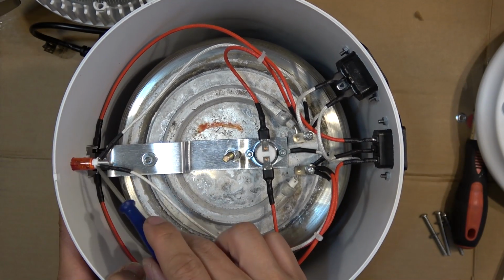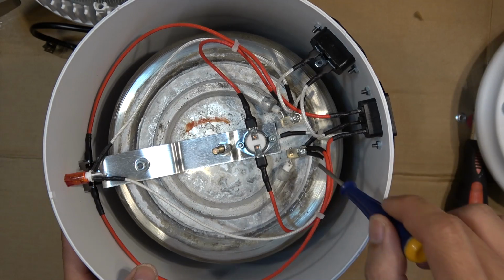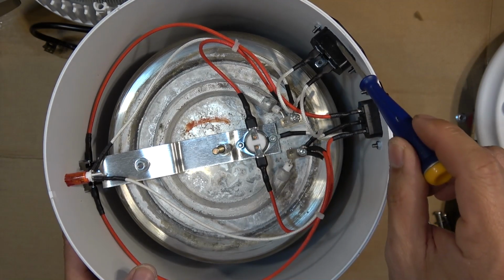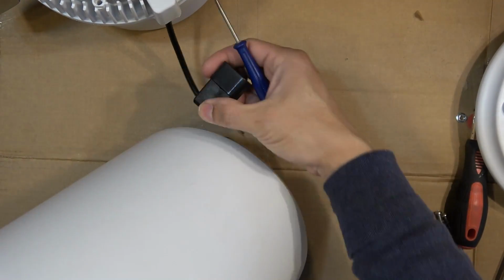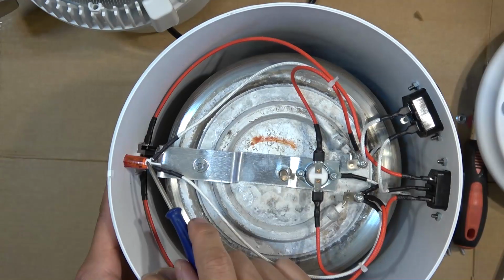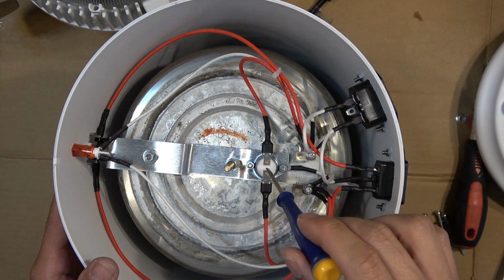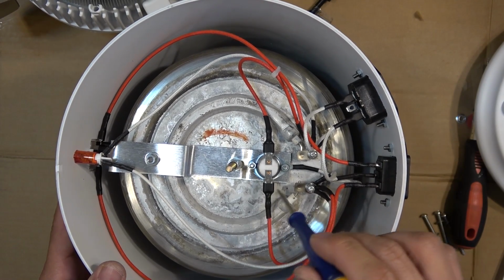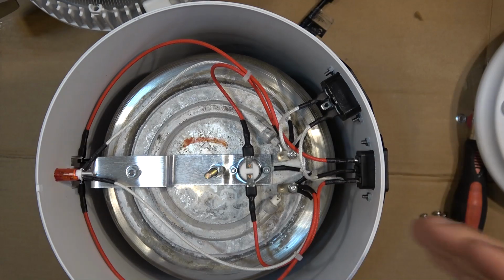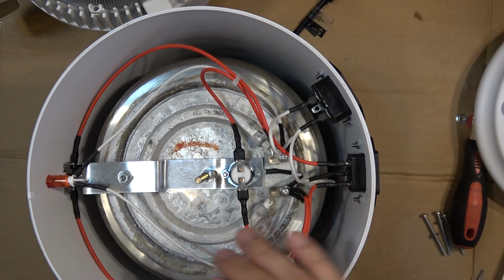The two wires from the light bulb are the same. One side goes to one side of the heating element. The other goes to the other side. So they are connected in parallel. The fan, which is this, you hook this wire up to here. The light bulb and the heating element are connected in parallel. So once this sensor turns off the heating element, it turns off everything including the fan and the light bulb on the front here. So everything here runs on AC, the fan, the light bulb, the heating element, everything runs on AC.